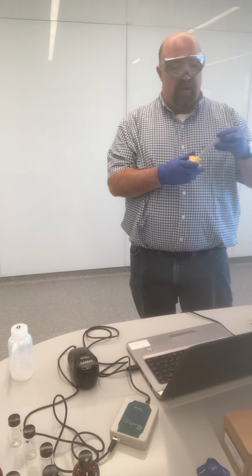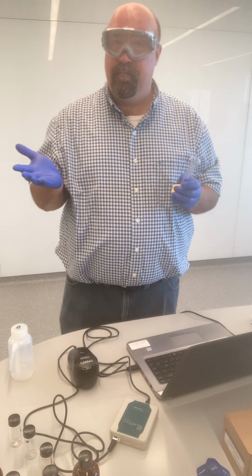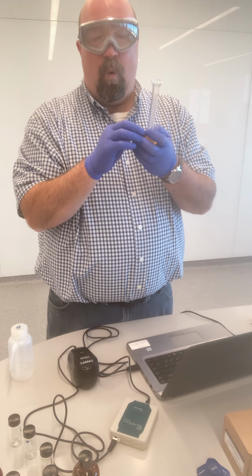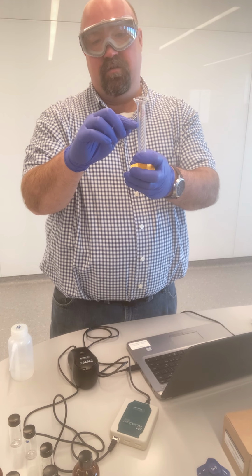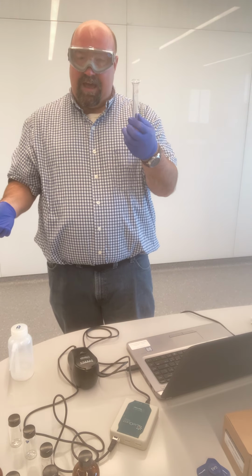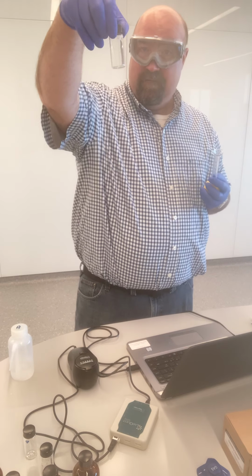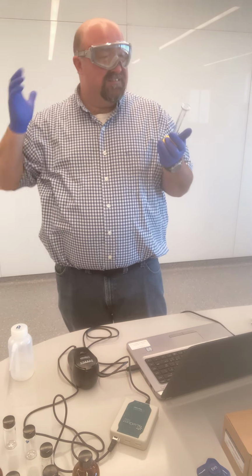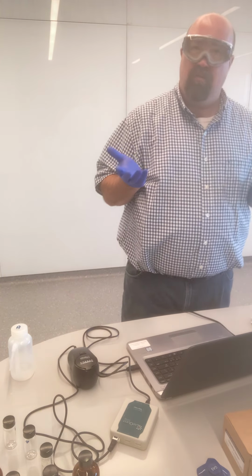I mean, essentially, I'm going to take something and dilute it by a factor of 10. So I could, for instance, take a 10 mil graduated cylinder, add 1 milliliter, and then dilute that up to 10 milliliters, and that would give me a 10-fold dilution, and then I could measure that. A couple problems with that. One is that 10 milliliters I don't think will be enough for our cuvette. Also, measuring 1 milliliter, not real accurate. It's tough to measure that small amount accurately.